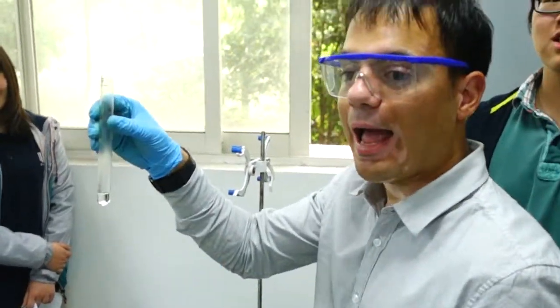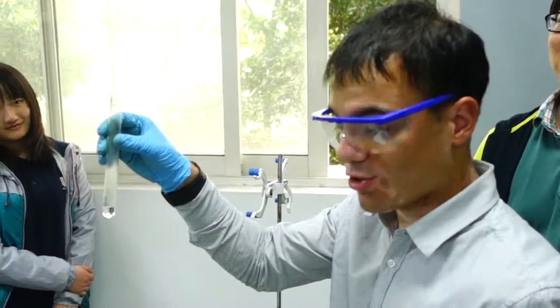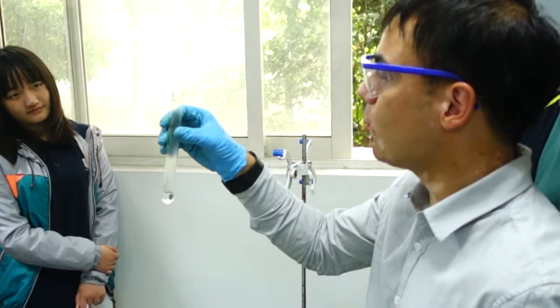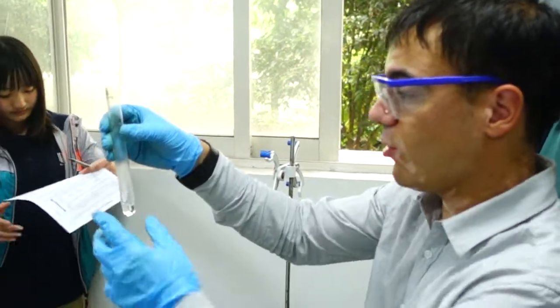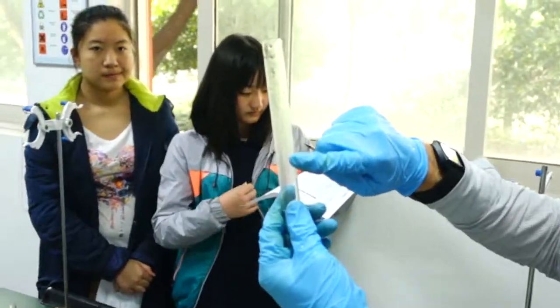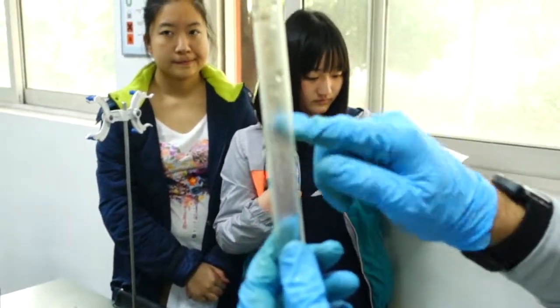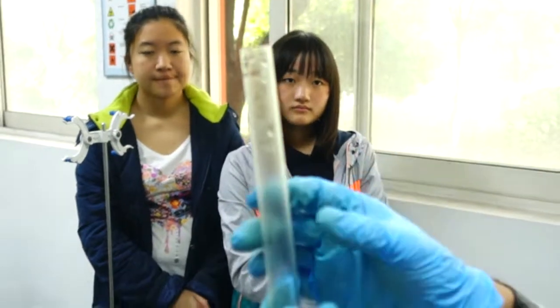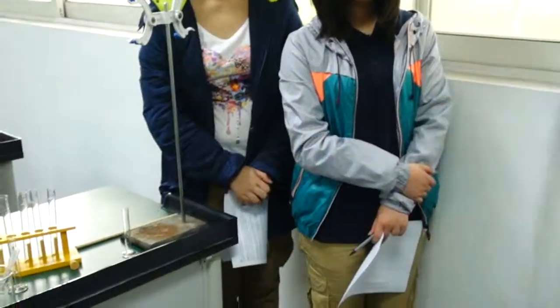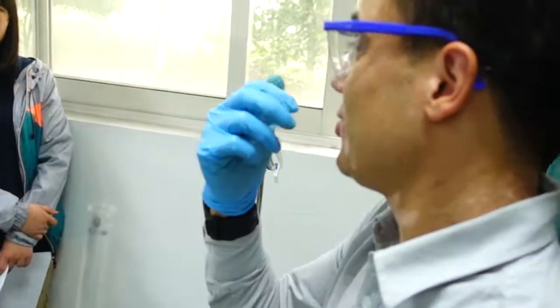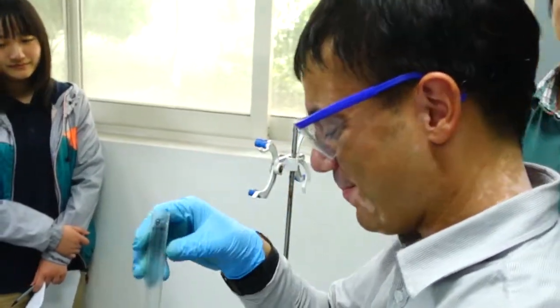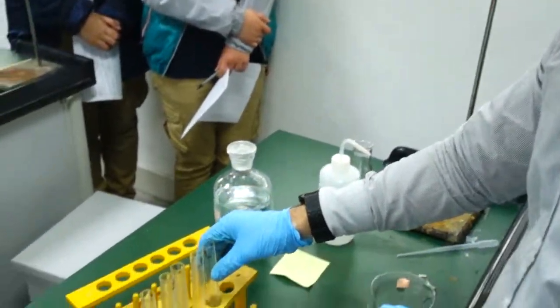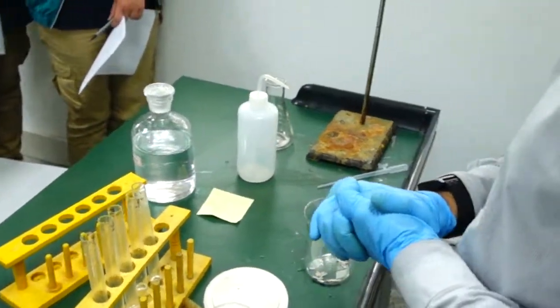I have concentrated hydrochloric acid, 12 mole per cubic decimeter, very strong. Can you see on the outside of the test tube we have fumes, condensation? If you smell it just a little bit, it irritates your nose. It's actually a little bit unpleasant.